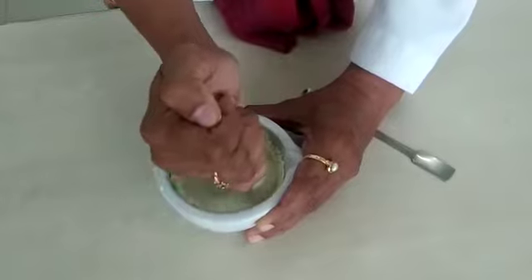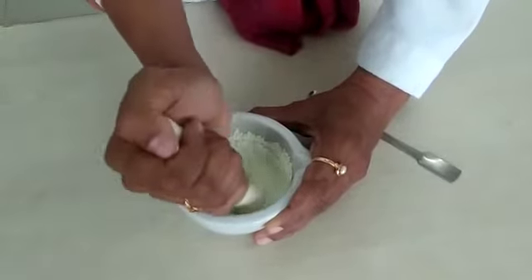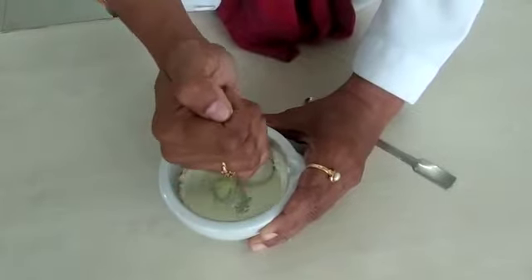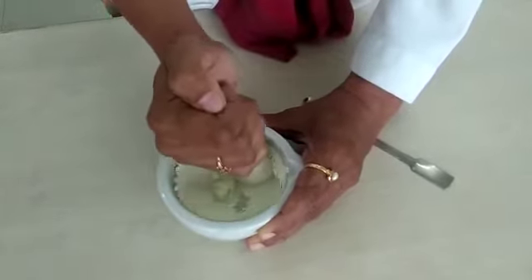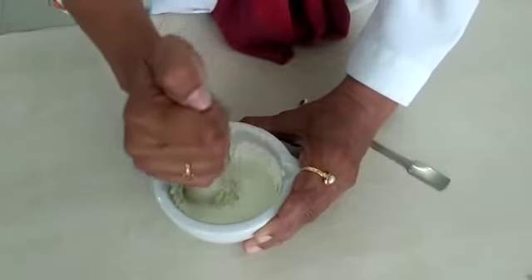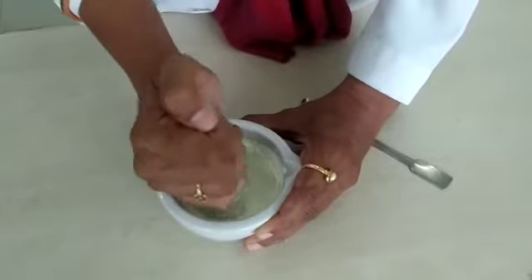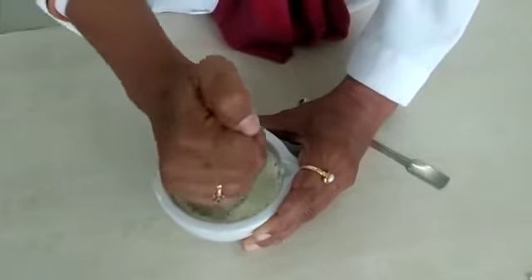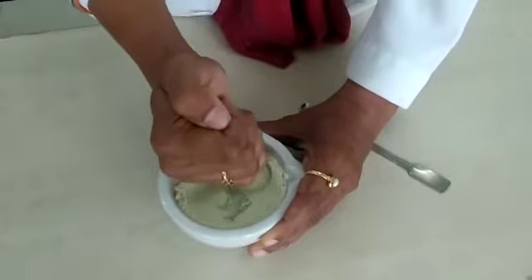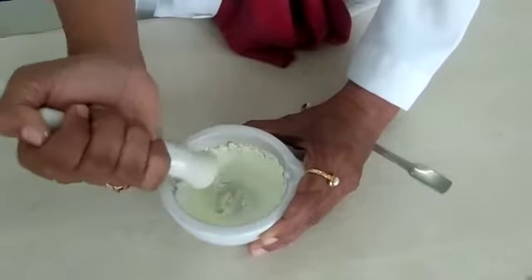Clockwise is acceptable, but the preferred direction is anti-clockwise, and you are not supposed to change direction in between the process. For the entire 1 hour you are going to follow the same direction for grinding the drug substance. This method is called grinding, and for the first 6 minutes you are going to grind the drug substance.